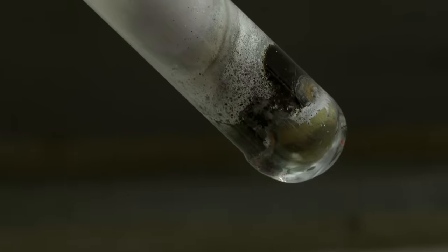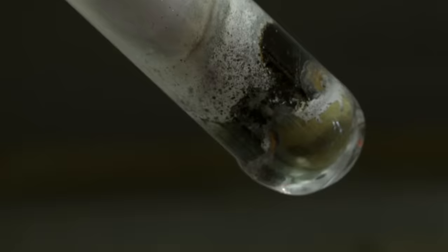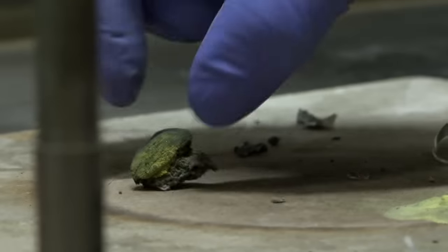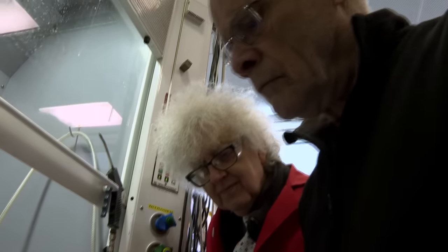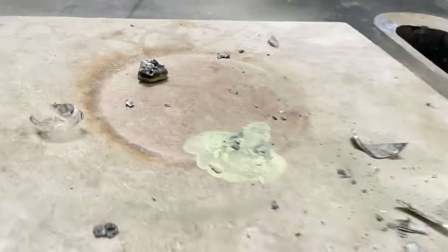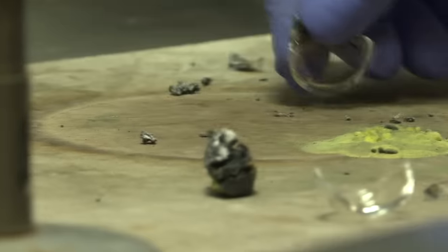Artyom's recipe said you had to smash the test tube at the end to see the colors. And perhaps the oxide had got slightly yellower. The idea being that the sodium should combine with it and make what is called tungsten bronze, a solid that looks like the metal bronze or the alloy bronze. And if you get the amount of sodium less, you can get a whole rainbow of different colors.